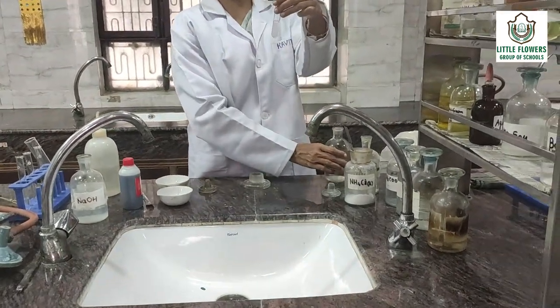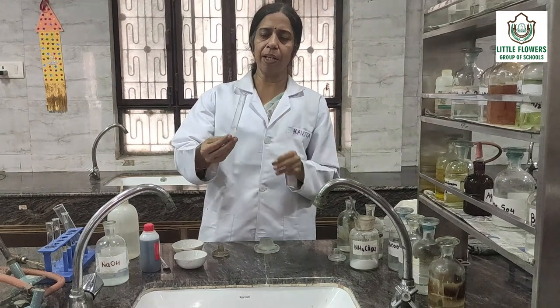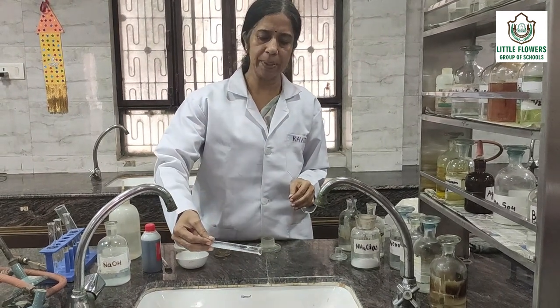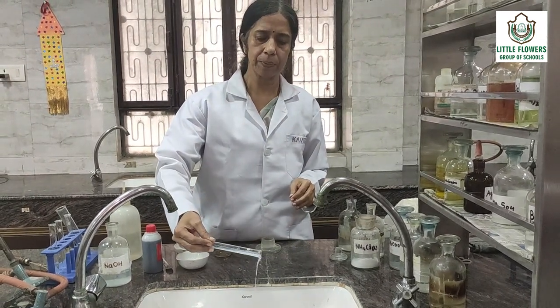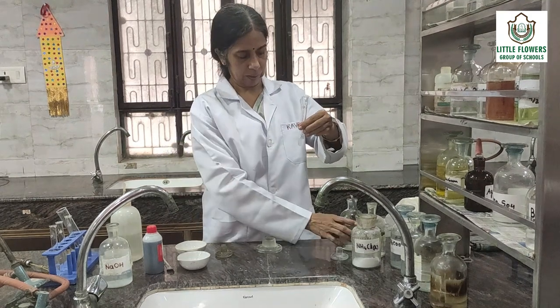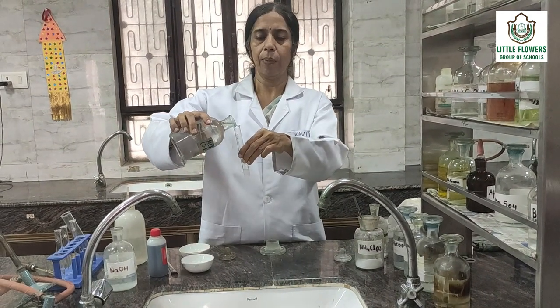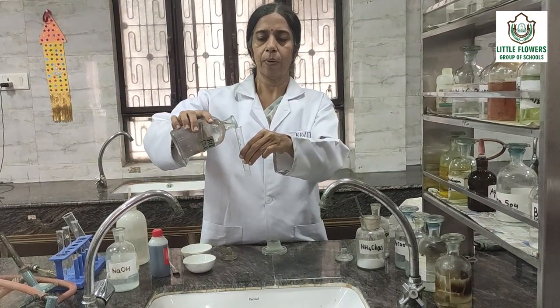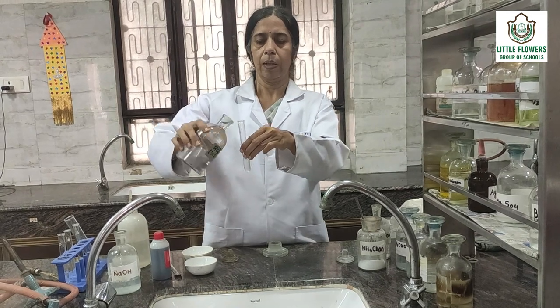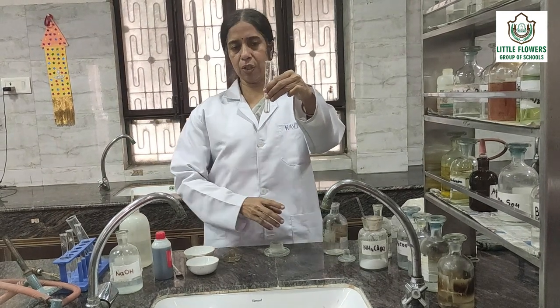If you see more PPT is there, then we will reduce the quantity of PPT. Add the dilute acid. You see, the PPT is dissolved.